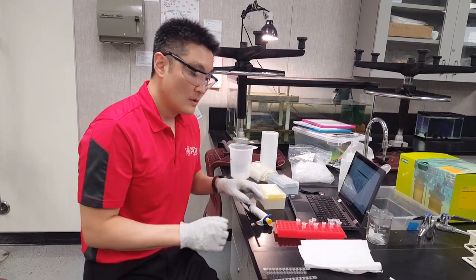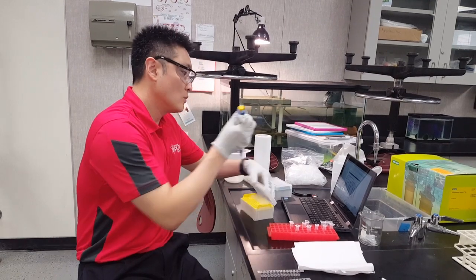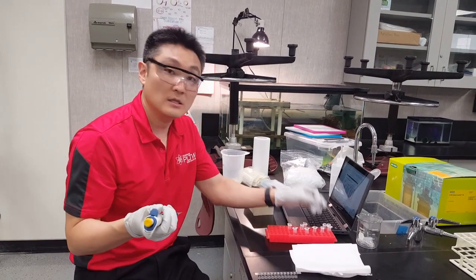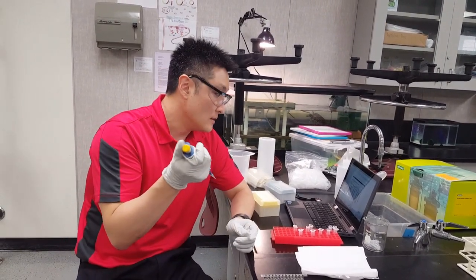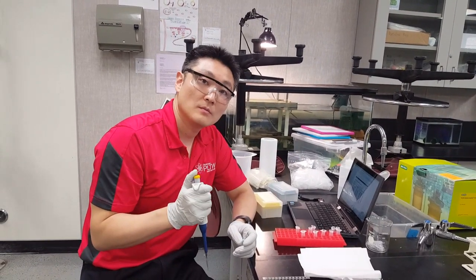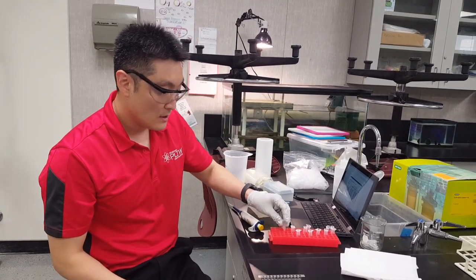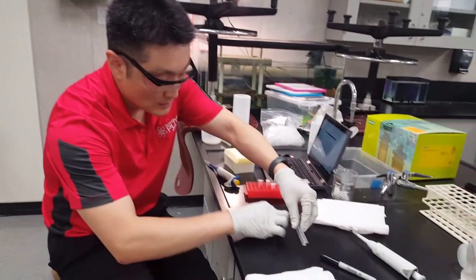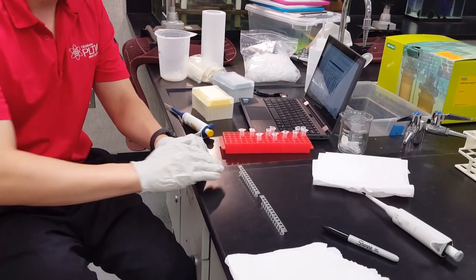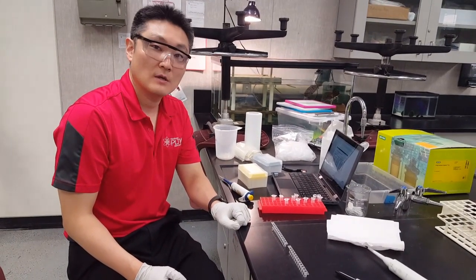Change tips and add the stop solution — labeled ST at your tables — 50 microliters to every single well. Afterwards, you'll see a color change happening. Line up your wells and use your camera to take a photo of each strip so you can see the color changes and determine who has meningitis. And that's it!